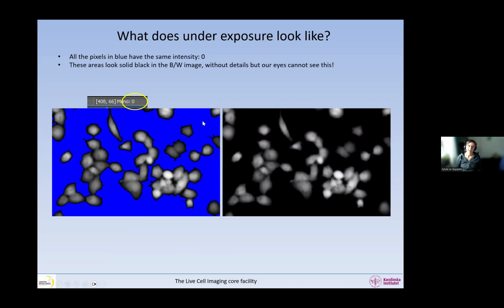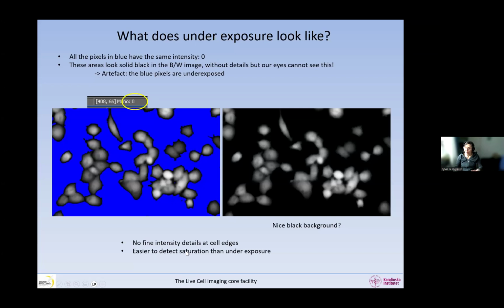If you do not have the saturation and underexposure mask, it is much harder to see that there is a problem with the images when they are underexposed. This is solid black, but since it's normally quite black anyway, we will not notice until we put the saturation mask on. Without the mask, our eyes cannot see it, but there are no details in the background at all. So this is also an artifact, and all the blue pixels are underexposed. It's a very nice background, right? But there are no fine intensity details at the cell edges, and everything has been eaten up.